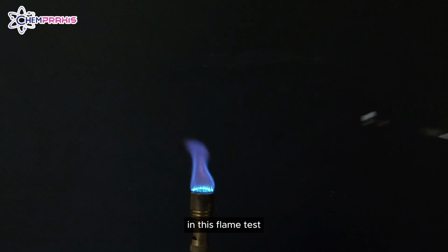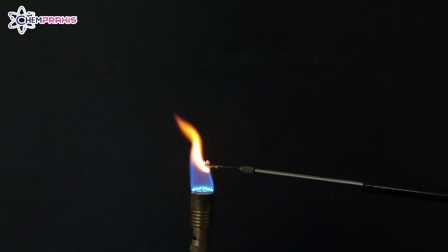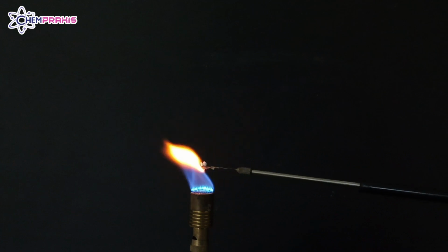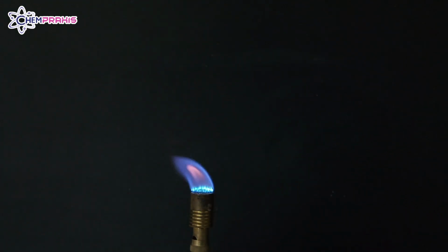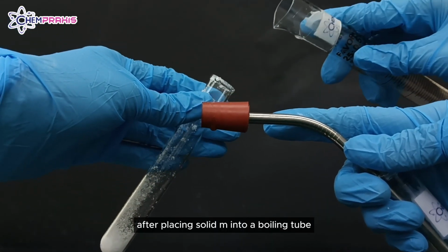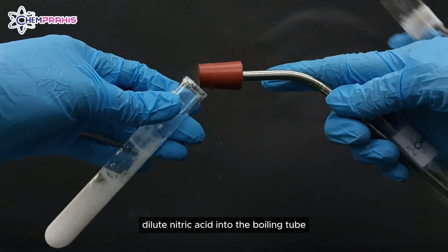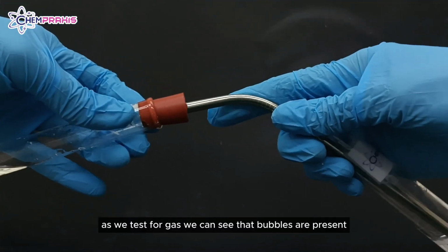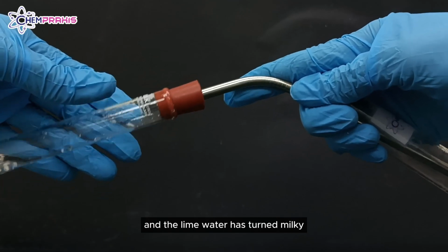In this flame test, a yellow-colored flame can be observed. After placing solid M into a boiling tube, add about 10 milliliters of dilute nitric acid into the boiling tube. As we test for gas, we can see that bubbles are present and the lime water has turned milky.